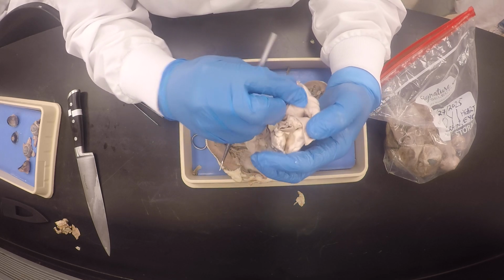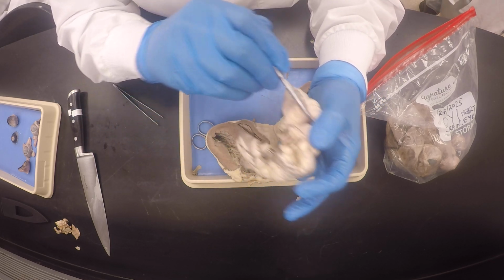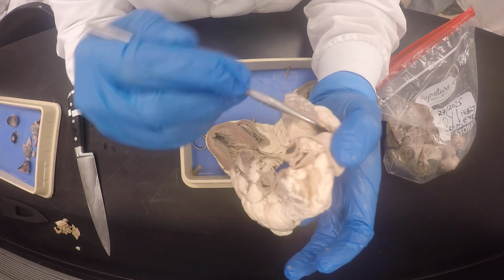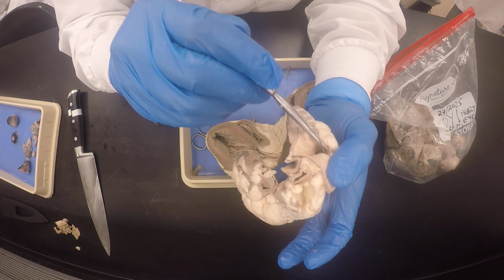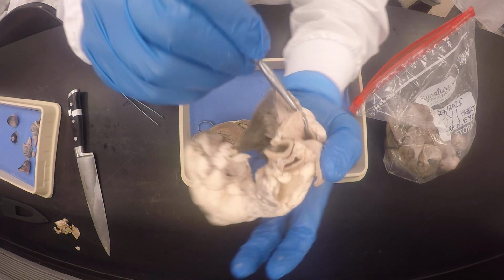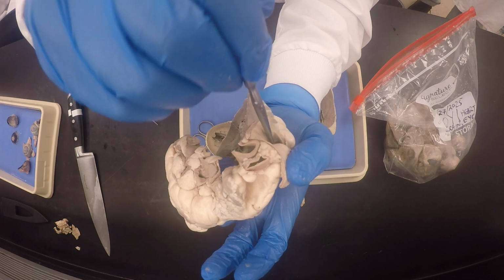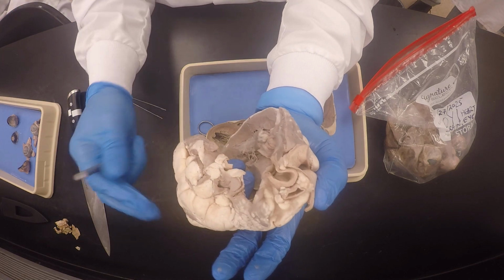Is it just me or what? Do you see the flaps? There's the flaps of the pulmonary semilunar valve. These are the flaps. Do you see them? You see? The semilunar valves are like this. You see what I'm saying? Looky here, my good friends. These are them, the flaps. So that's the pulmonary semilunar valve.